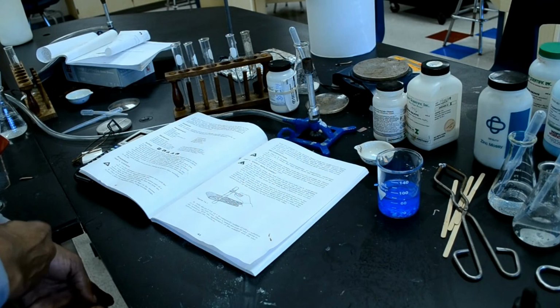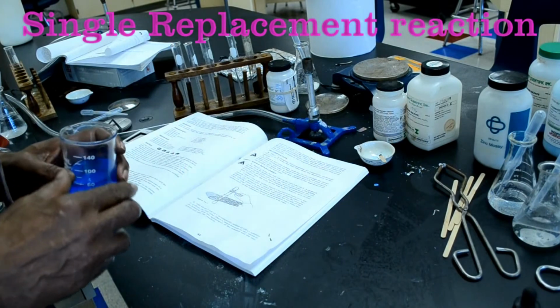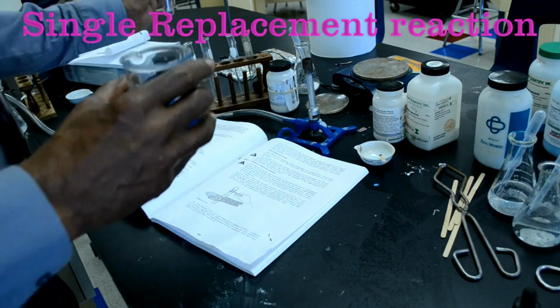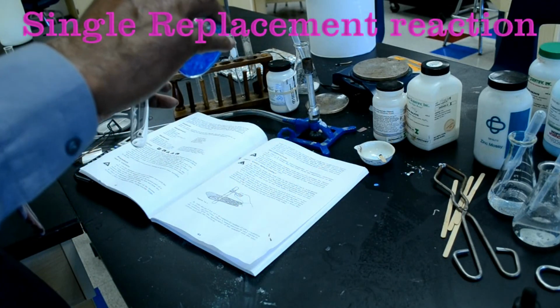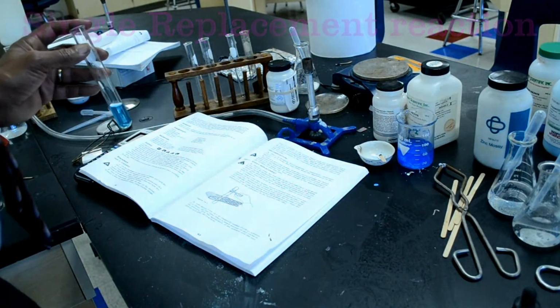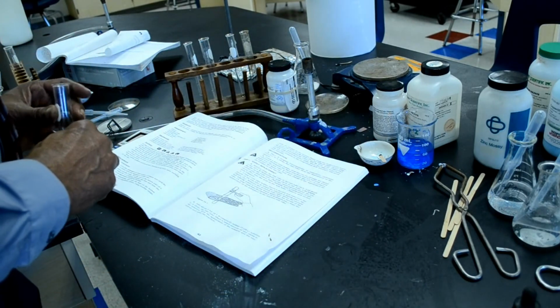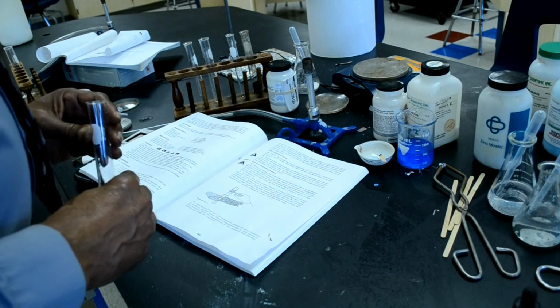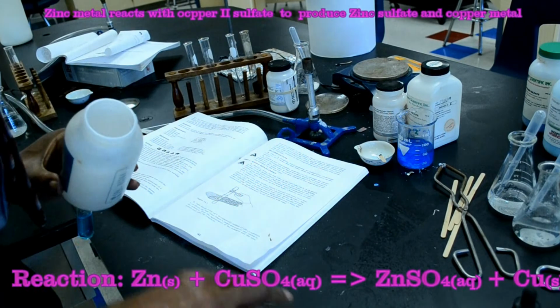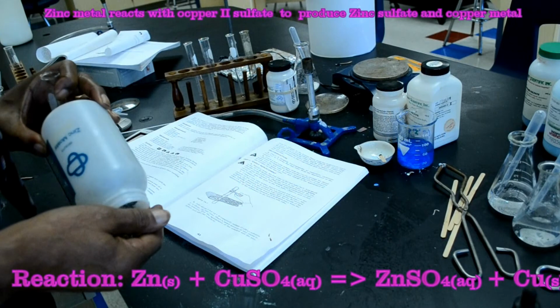Number 8. Add about 5 mLs of 1 molar copper 2 sulfate. That's this blue stuff right here. Solution to a clean, dry test tube. So I'm going to add about 5 mLs. That looks like about 5 mLs to me. Place a small amount of zinc metal in the solution. Note the appearance of the solution and the zinc before and after the reaction.